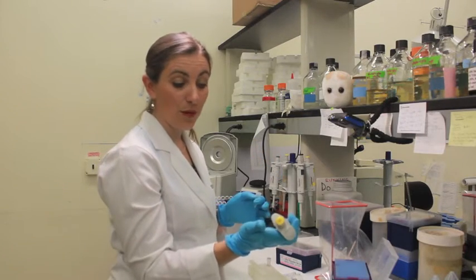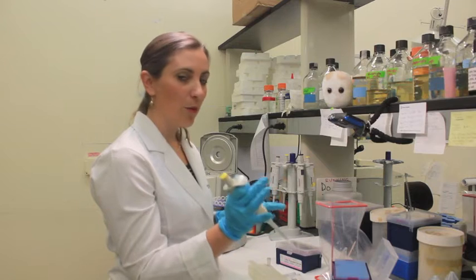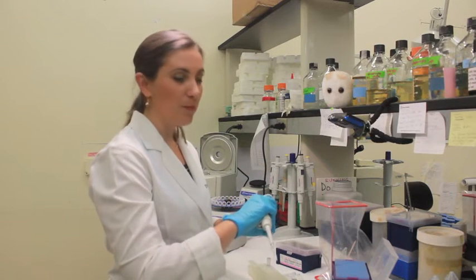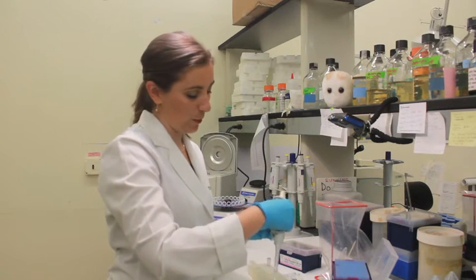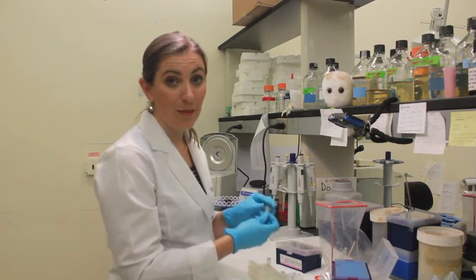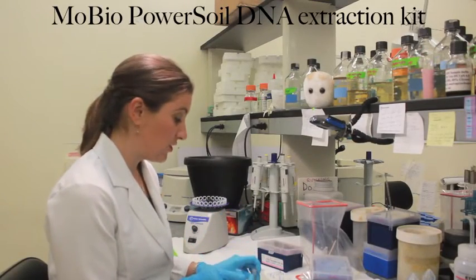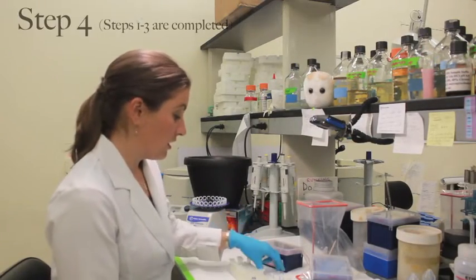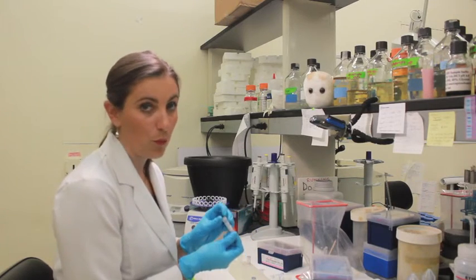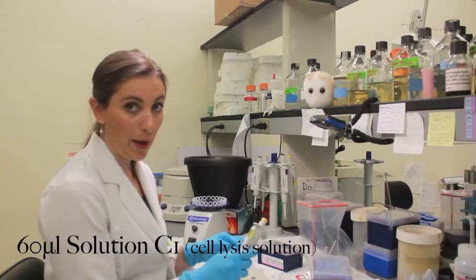I have set my 200µL pipette to about 100. That should be how much liquid was remaining, but be prepared for it to be a little bit more or less. We are ready to begin the MoBio protocol to extract DNA. The first step of the MoBio kit is to add their first reagent called C1. We are only going to add 60 microliters of C1 into the power bead tube.